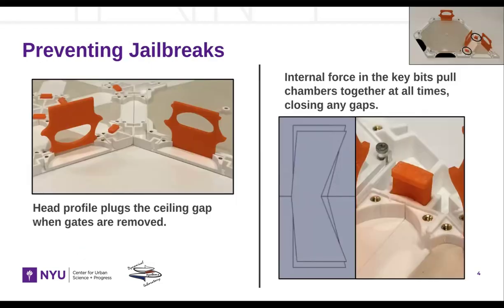First, ants are notorious jailbreakers, so we need to give special attention to preventing escapes. The dual function gate can be opened and closed without displacing the acrylic lids, and it cleverly plugs into the gap to prevent escapees when gates are opened. When inserted, self-clamping keys pull the chambers closer together, like a reusable wedge tenon and mortise joint used in woodworking. These components create an ant-tight seal.